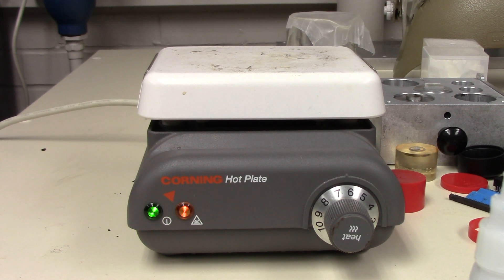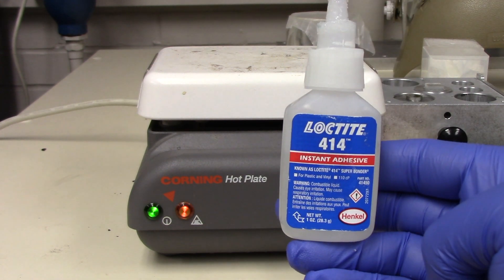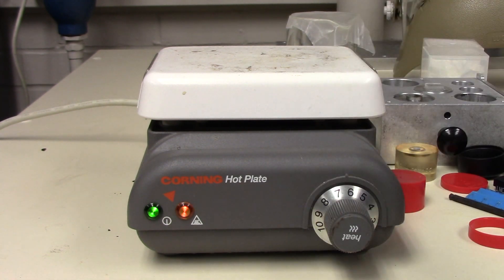Alrighty. Now that that's getting ready, what you'll want to do in this case is start preparing your second adhesive. So, what I'm going to use for right now is I'm going to use this super glue that I have over here. But you can also use something like epoxy or whatnot.